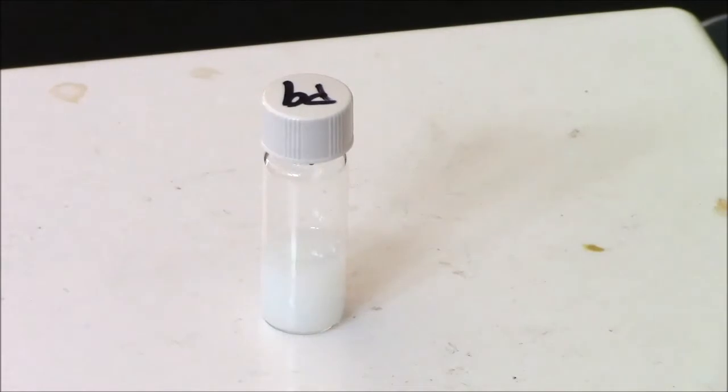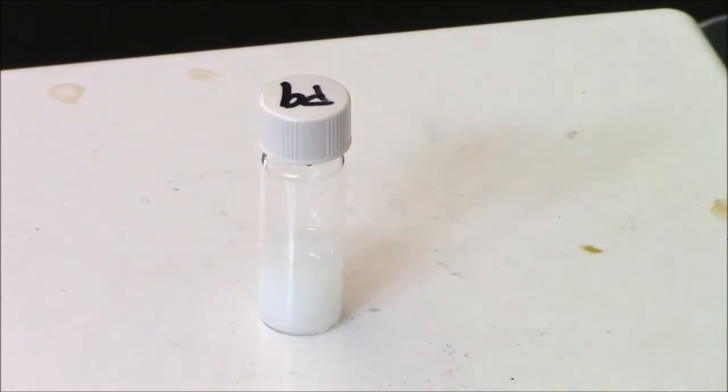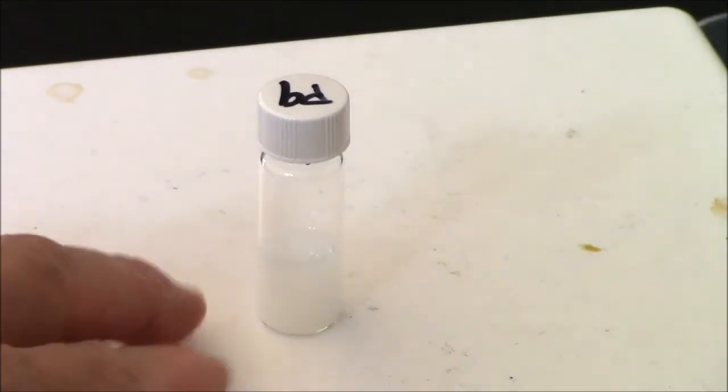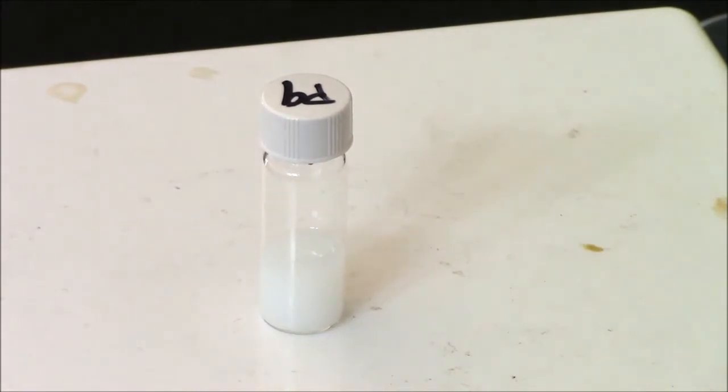Here is the polymerized product. This is a particularly dense polymerization. It is very opaque. Normally we see it as a little more transparent.